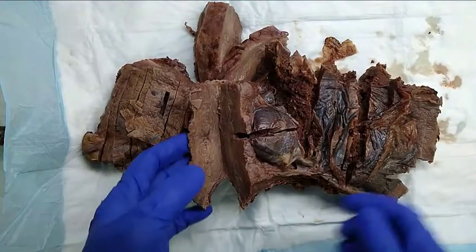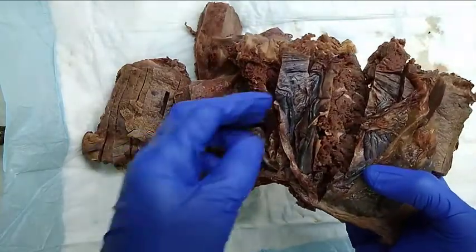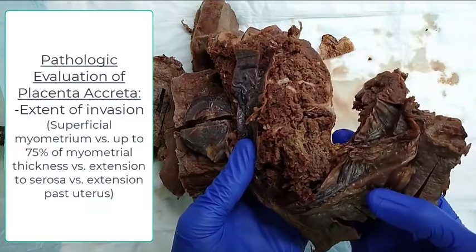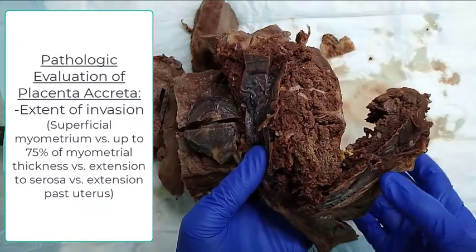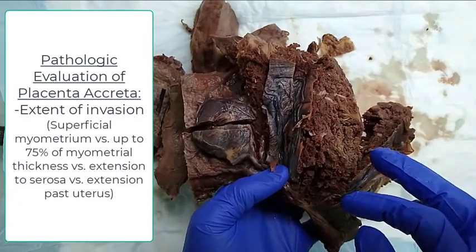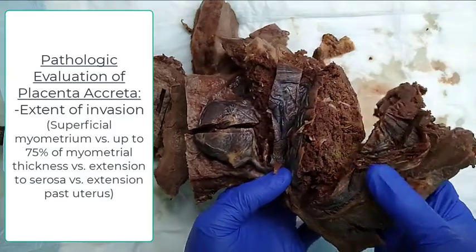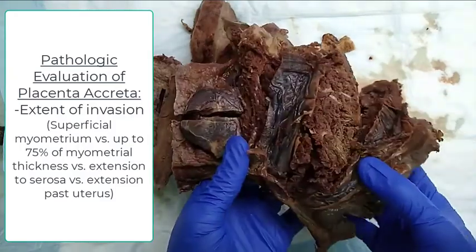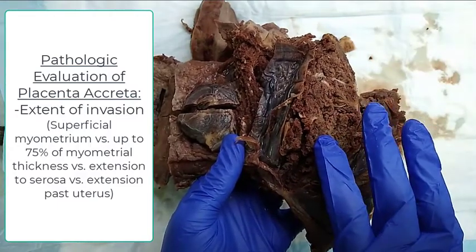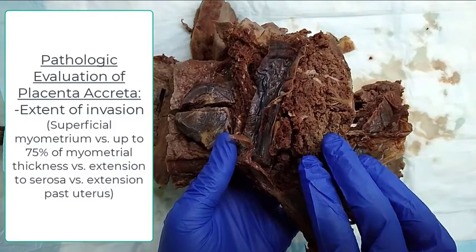When we evaluate these accreta specimens or hysterectomy specimens, we're trying to evaluate how deep the placenta invades into the uterine wall. So there are several stages of invasion. The first would be just superficial invasion into the superficial myometrium, which is not the case here. The second stage would be invasion into the wall up to 75% of the thickness.